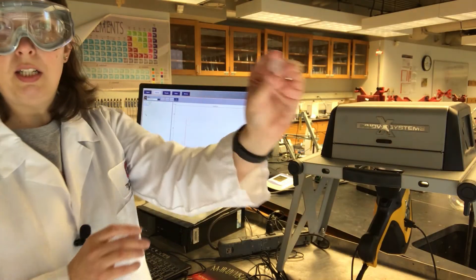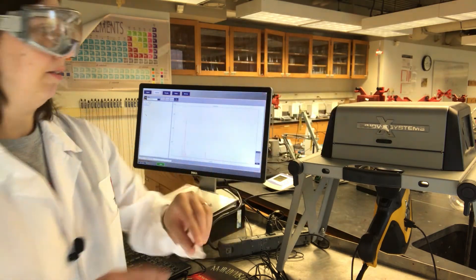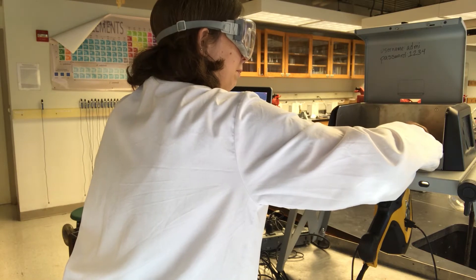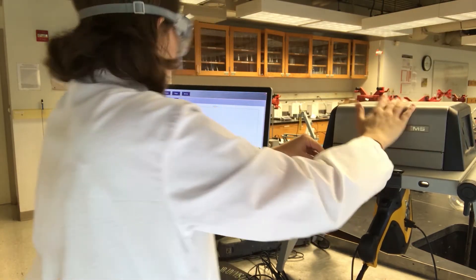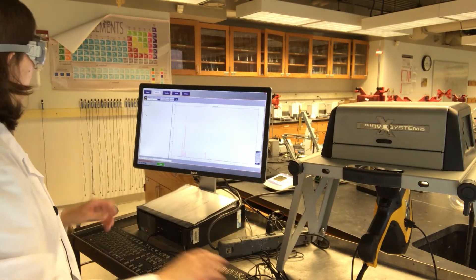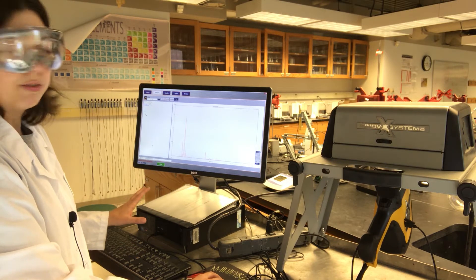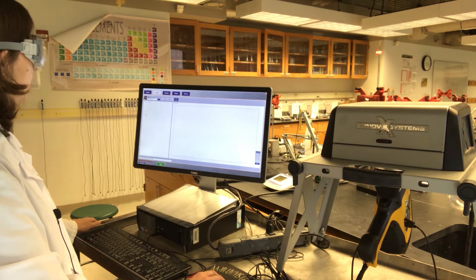First we'll put the copper side of the penny down on the window. I am in alloy mode here, so it's going to analyze for metals. I'm going to click start.